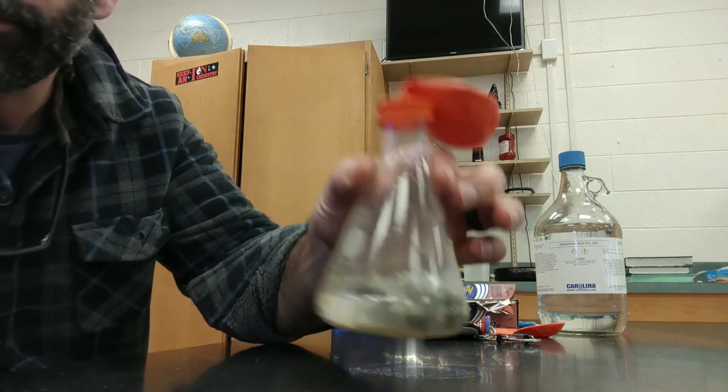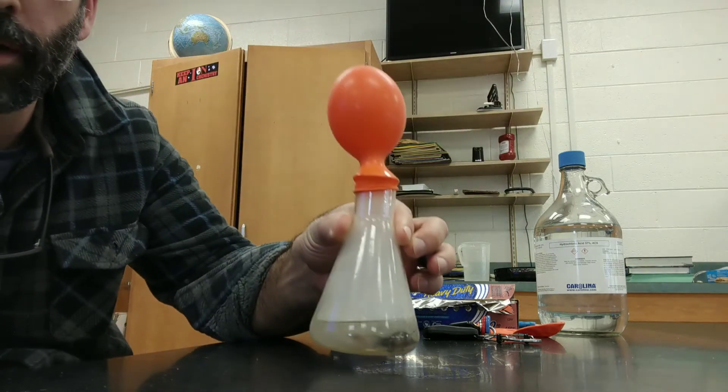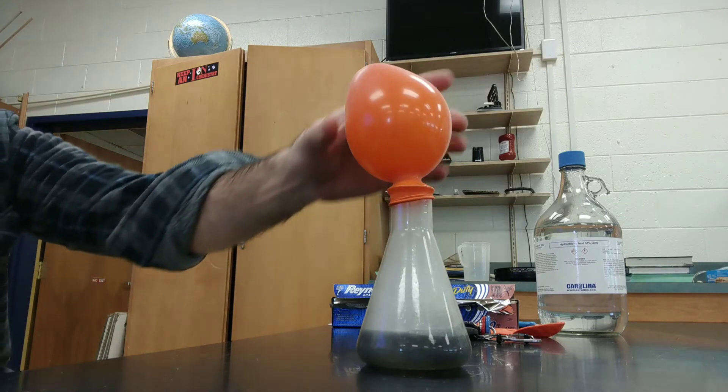You can see the reaction is already starting. This is where I back up a little bit until it's all finished.